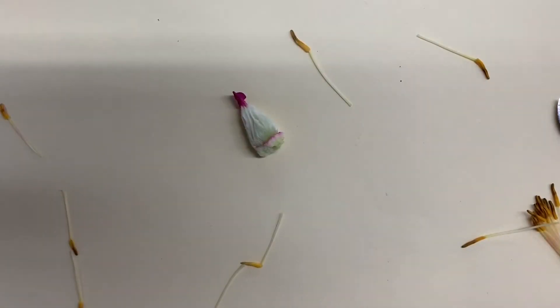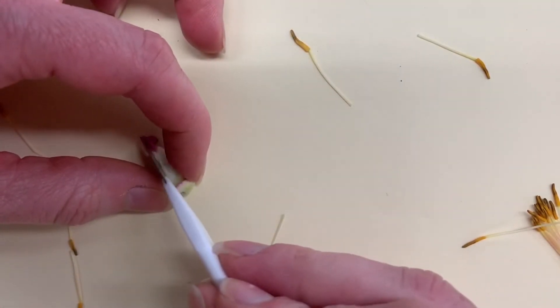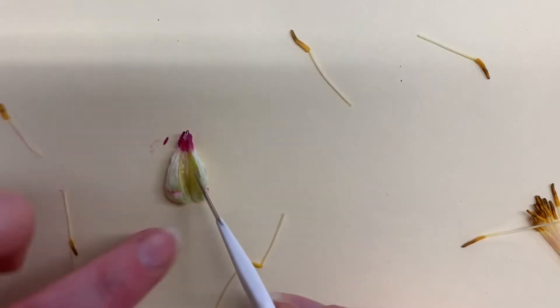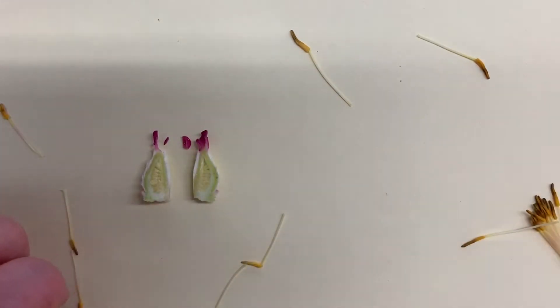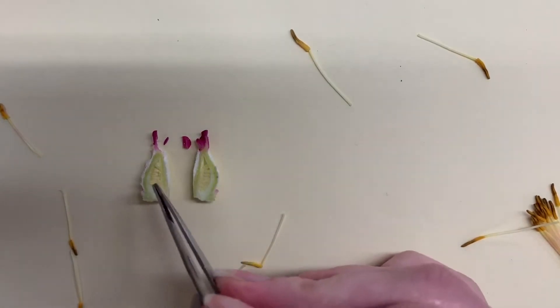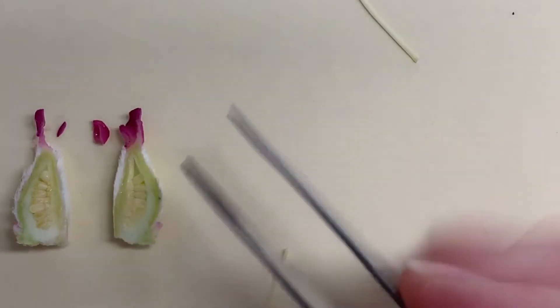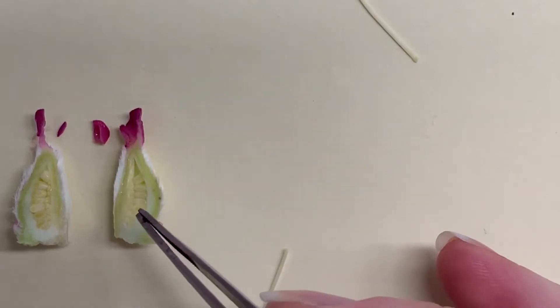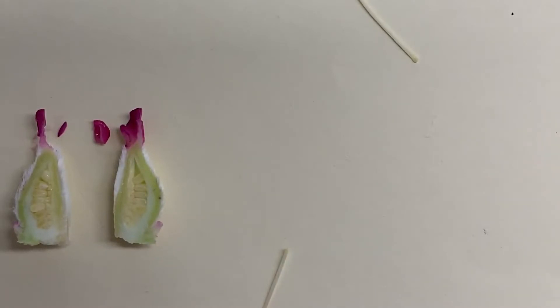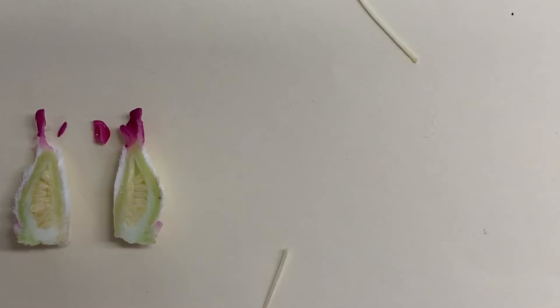I've zoomed in a little bit closer and I'm going to cut the pistil in half to see what's inside. Here you have a nice clear view of the ovules, which are right there inside the ovary. These ovules turn into the seeds of the plant if they are fertilized by the pollen — specifically the sperm within the pollen.